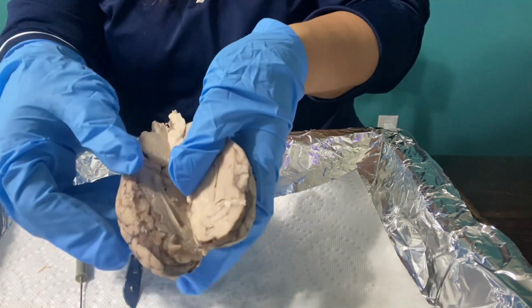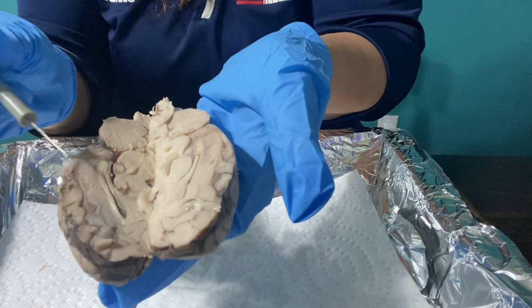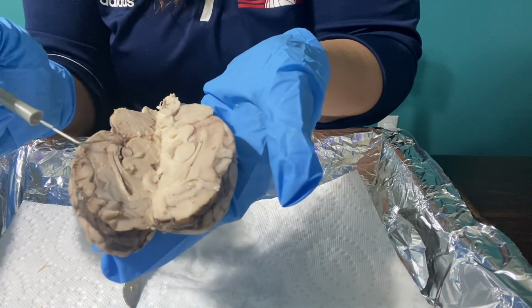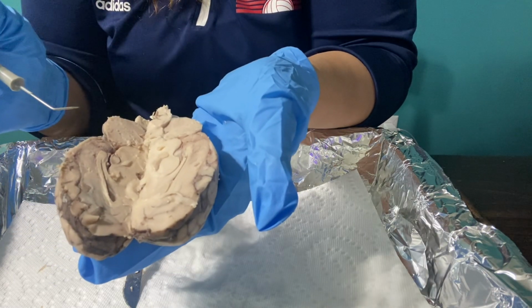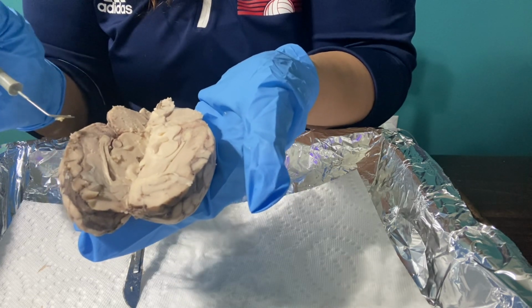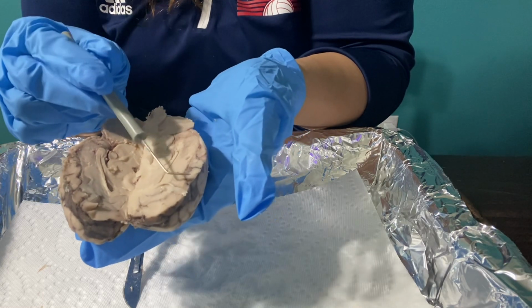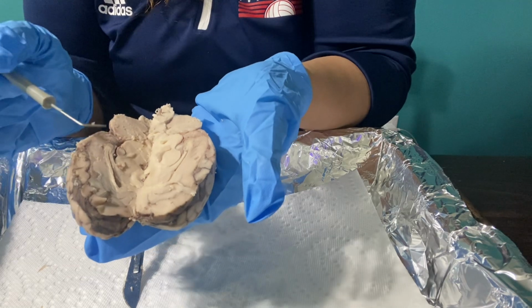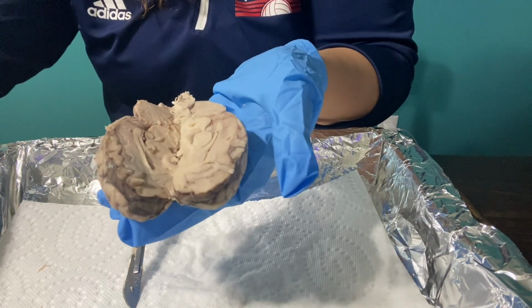What I wanted us to look at right now, first of all, is what it looks like once it is opened up. You can see that there are these little gray and white spots. So I want to talk about that. The gray matter, those are the dark regions that you see here. Those are responsible for processing the information. Then you also see the white matter. Those are the lighter regions that you see in the brain. This is where the information is relayed back and forth to those other neurons.